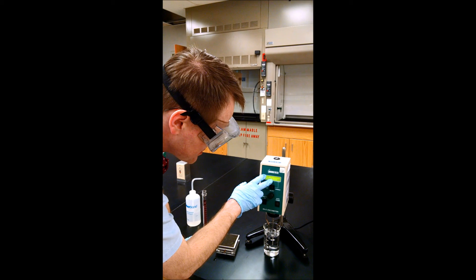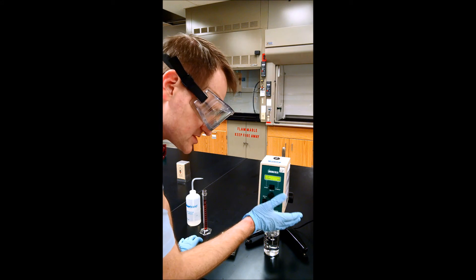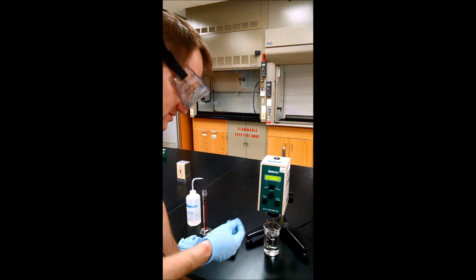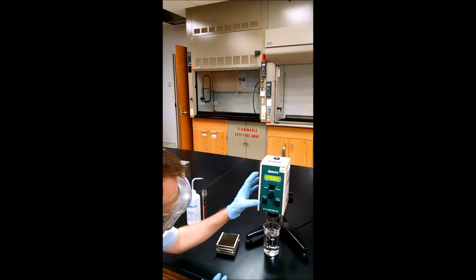You see that the measurement is blinking because we just turned it on, so it doesn't have any measurement yet. It stores the previous measurement once it does a measurement. Let's go ahead and turn on the motor.